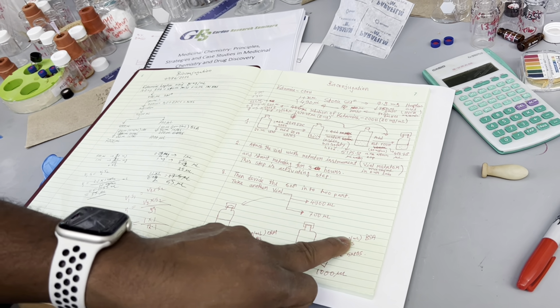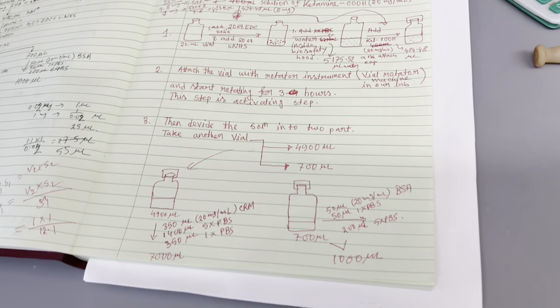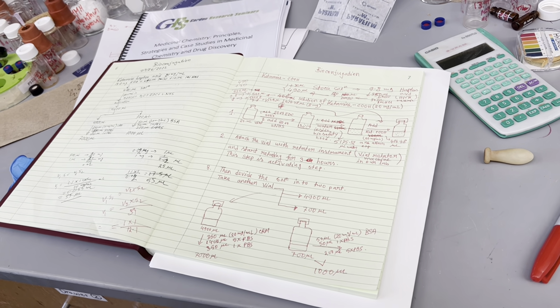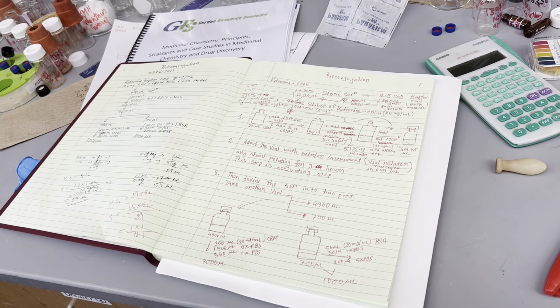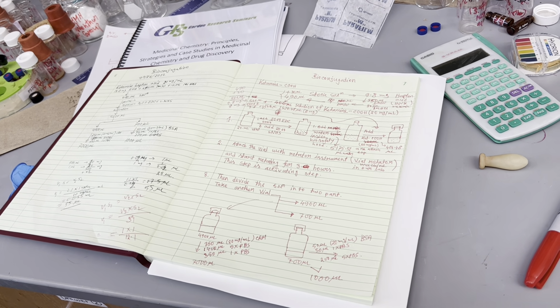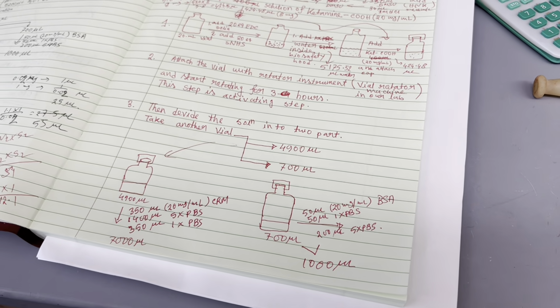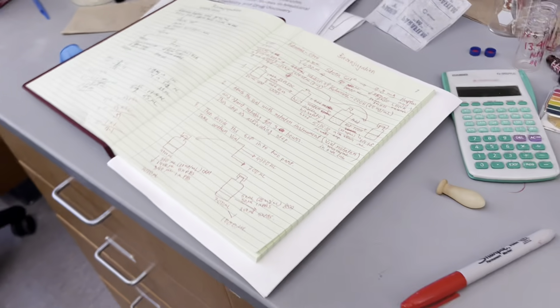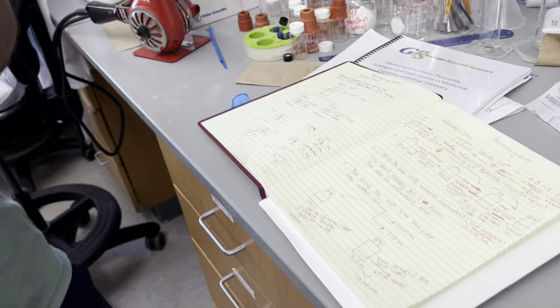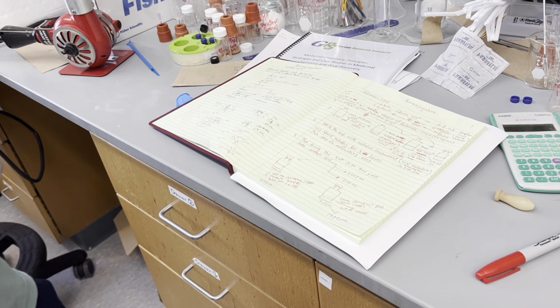So you have to make a solution, like measure a certain amount of the BSA. Suppose you have taken 10 milligrams in a vial. So if you add 500 microliters, then it will be 20 milligrams per ml, right? Wait, did you say 10 milligrams? Yeah, if you take 10 milligrams and add 500 microliters of solution. Oh, when you say 10 milligrams, it's dry. BSA is solid, right? Yeah, BSA is solid. And if you add 500 microliters of water, it will be 20 milligrams per ml, right?